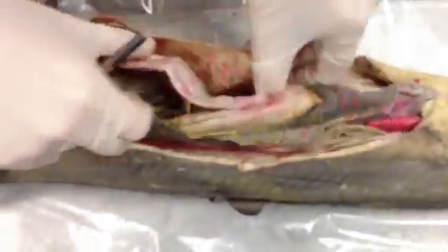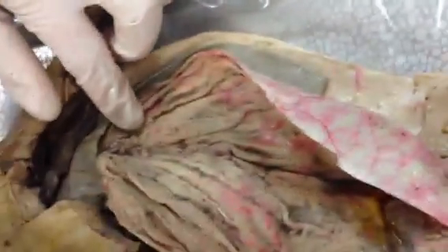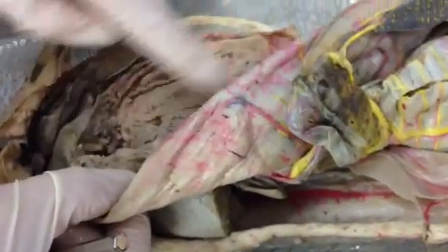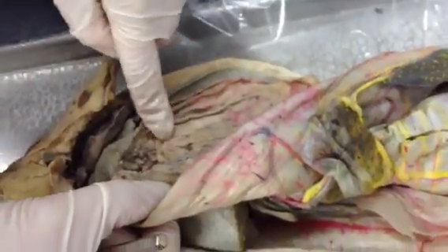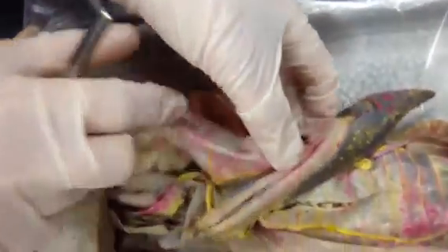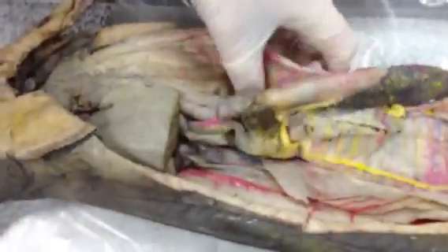For the structures of the digestive organs — when you cut through your stomach and looked inside — for the esophagus you saw the papillae, and for the stomach you saw the rugae. The cardiac region is the more cranial region of the stomach; on some specimens the distinction between esophagus and stomach will be harder, so mainly know the definition of the cardiac region. The body is the bulk of the stomach, and the pyloric region is where the pyloric sphincter is located. The greater curvature is where the mesentery attaches, and the other side is the lesser curvature.